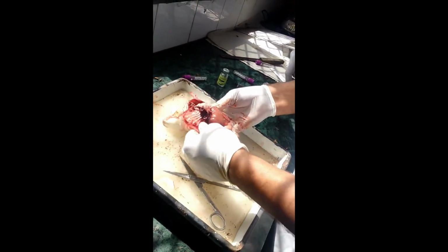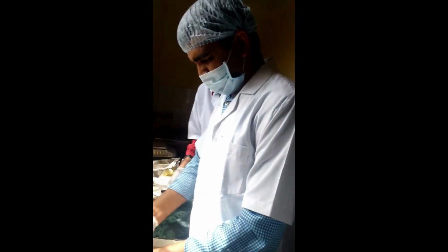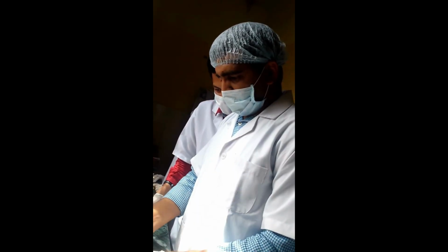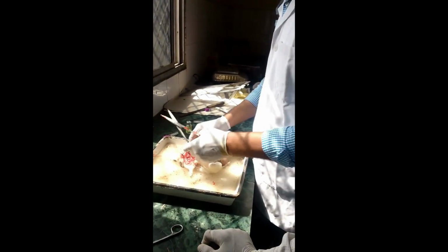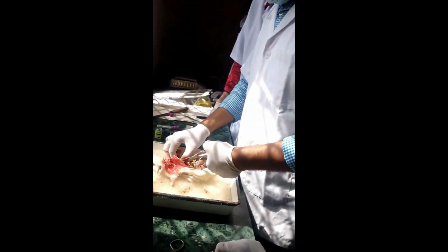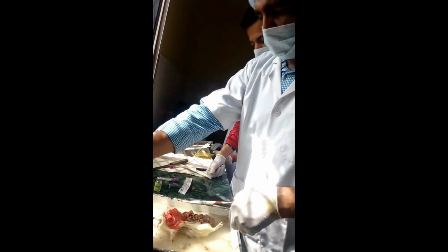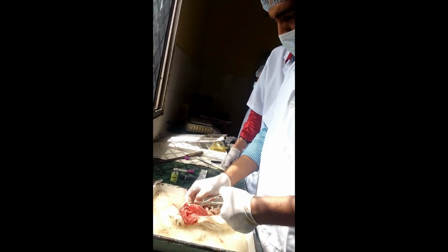Next, we will remove the liver gently. Wipe any releasing blood properly using gauze to maintain clarity. Otherwise, you can see here in this video, the blood is already spread around the dissection body. So in this condition it is very difficult to remove other organs from the dissection body of the rat.